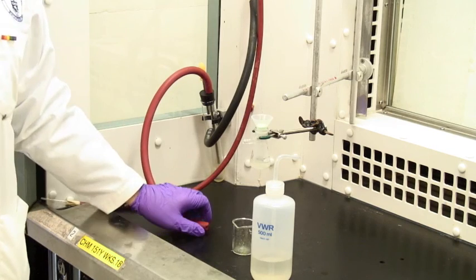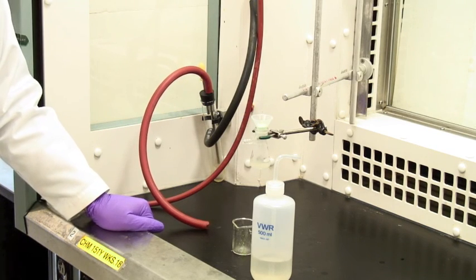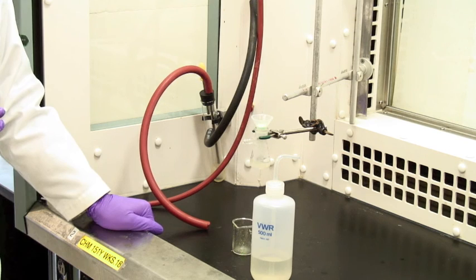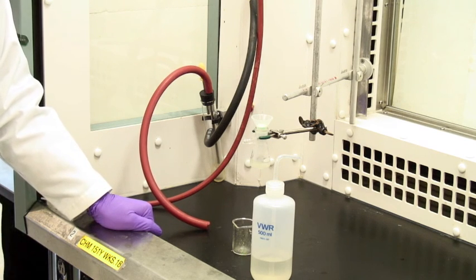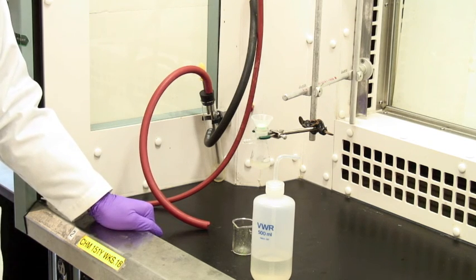Do be careful not to over wash. If your product is slightly soluble, you'll cut your yield that way. If you're washing, if you do it in two batches, it'll be more efficient than in one large batch.